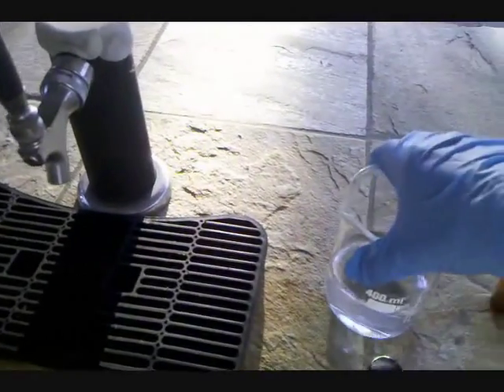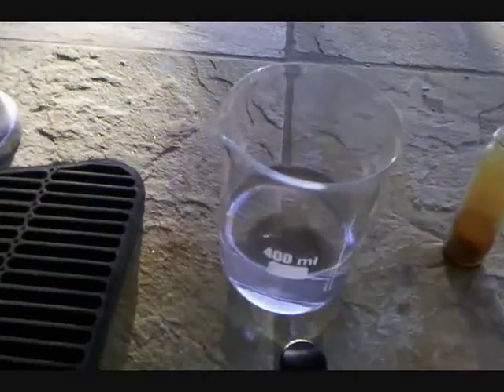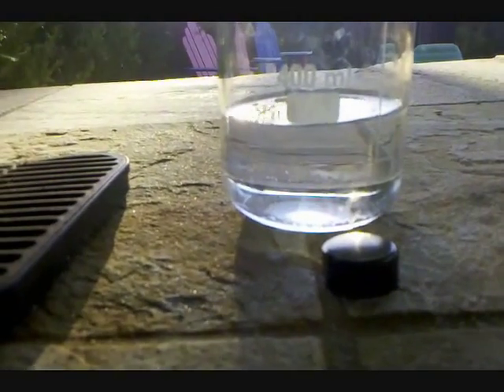The first reaction of chromyl chloride I'll show is probably its most famous on YouTube, and that is its reaction with dilute acidified hydrogen peroxide solution — a solution of hydrogen peroxide and hydrochloric acid that's been diluted. When chromyl chloride hydrolyzes in the solution, it reacts to form a peroxo-chromium complex that is a blue color, and it's a pretty cool reaction to watch.